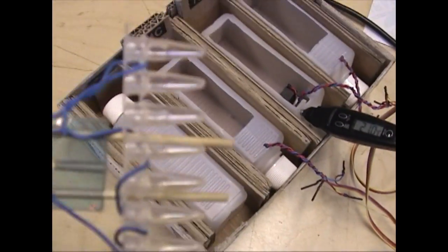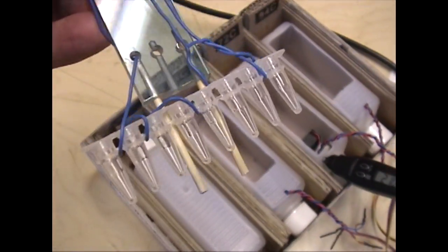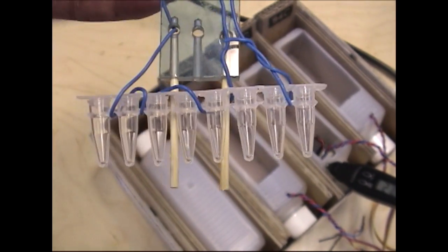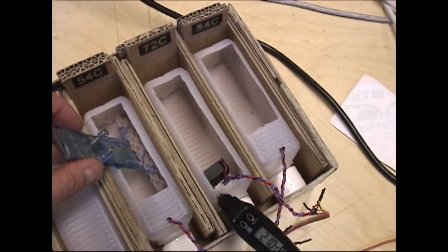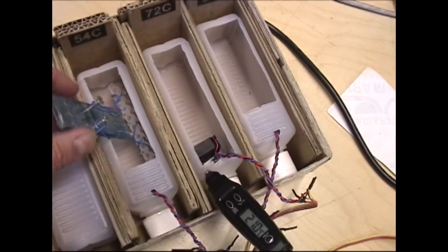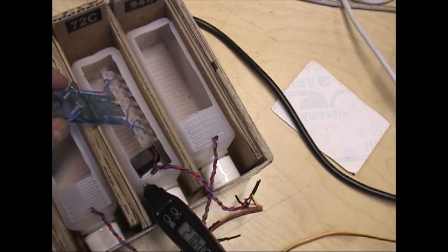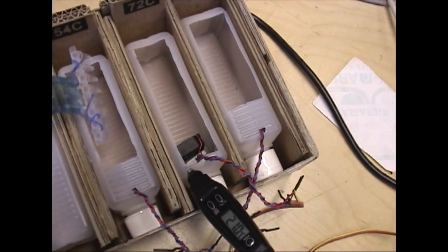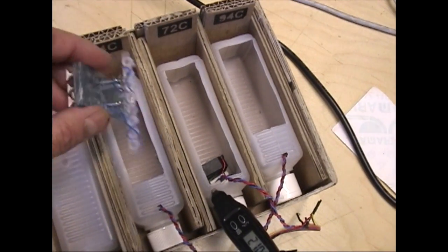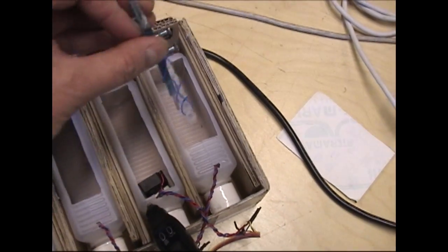The samples, PCR samples, this is a handle for the PCR samples. This is very simple. The reaction is put in PCR tubes, connected just with a wire to the handles, and then we can work it like this. Wait and make a cycle. Here, wait, then here, wait, naturally, and here, wait.